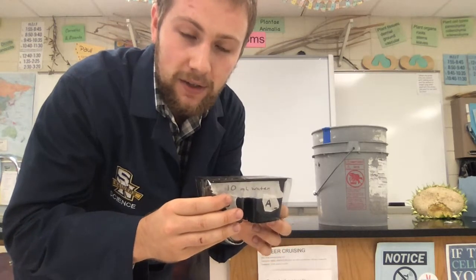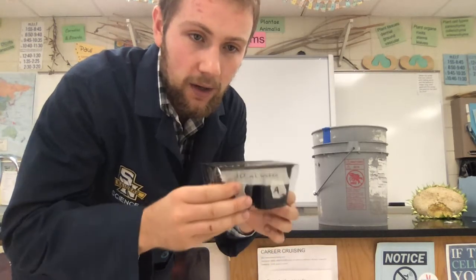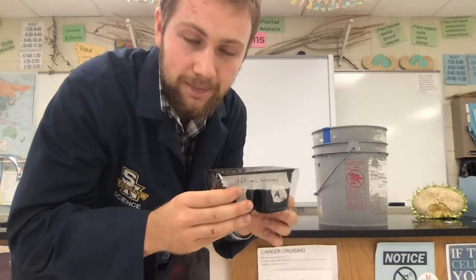So here is our day 0 data. Nothing has grown yet, and we've just planted. Okay, I think that is about it.